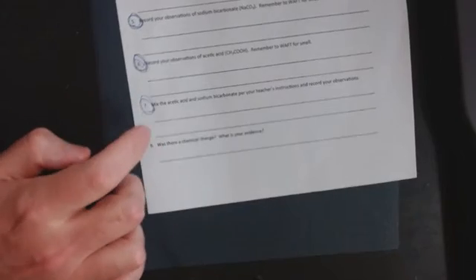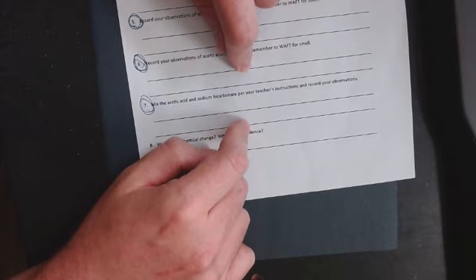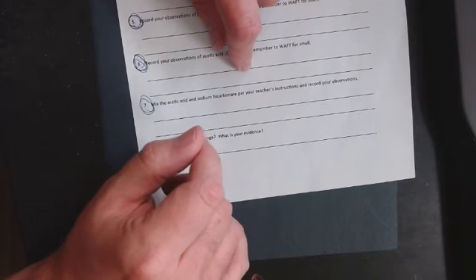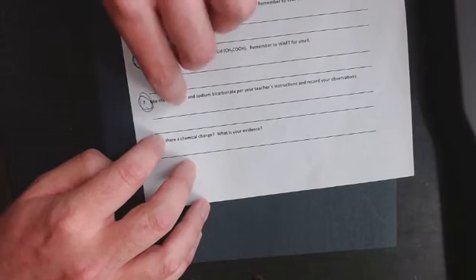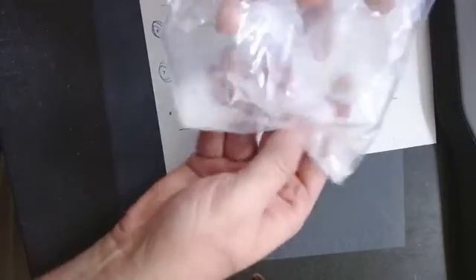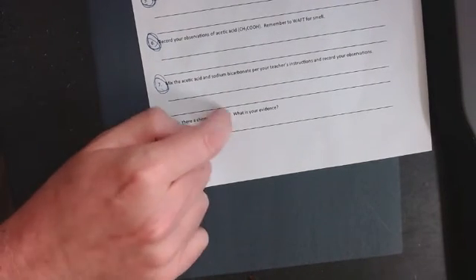So on number 7, what are your observations? Well, I saw bubbles, I heard fizzing, and I felt cold. There's a noise, I don't know what it is. So there is bubbles, fizzing, and I felt cold. Number 8, was there a chemical change? When we mix these two things together, did a chemical change take place? I'm going to leave that for you guys to decide. Using your observations, do we have evidence? What is your evidence that a chemical change has taken place?